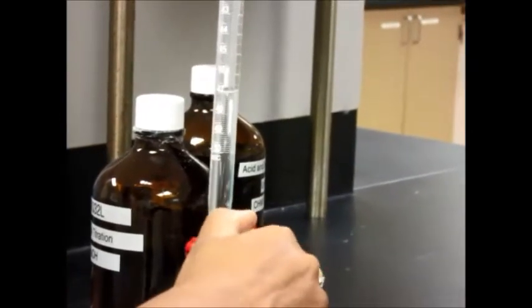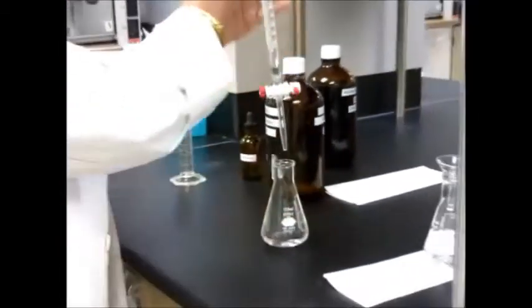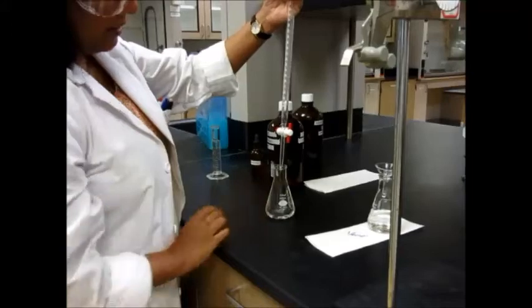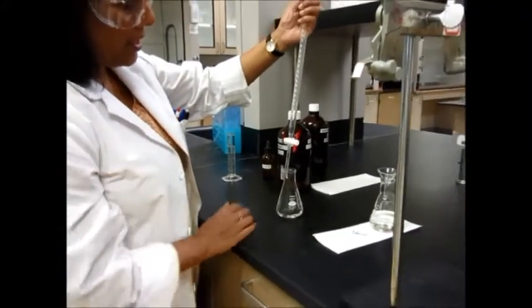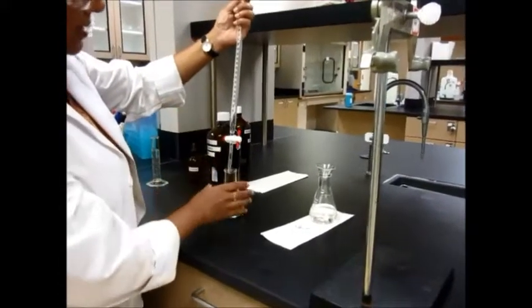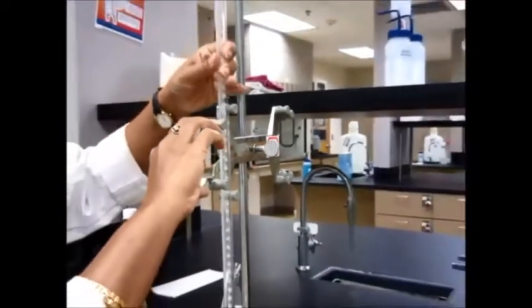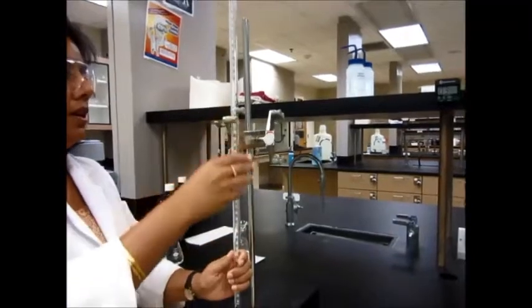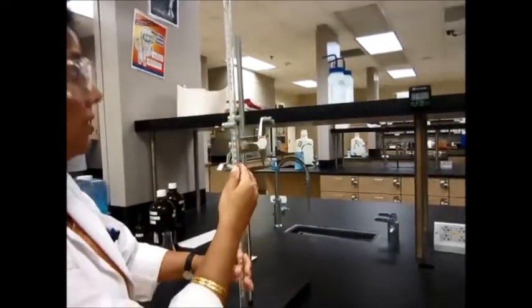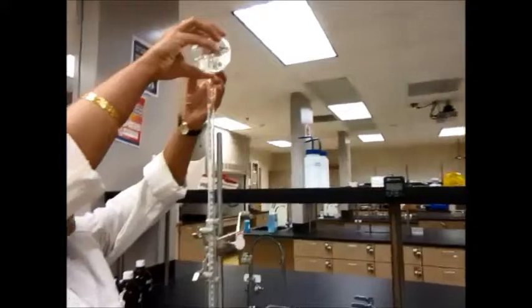Once it's come down and you want to close it and empty it out from here, that is absolutely fine. Make sure you release all the liquid you still have remaining. So that way when you fill it up again it's going to be all nice and clean. Don't try to blow out anything — whatever liquid is remaining, just let it be. Then close the burette, put it back in the grooves, and now your burette is clean and ready to use. Now you can fill up the burette.